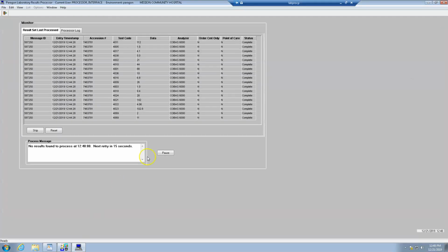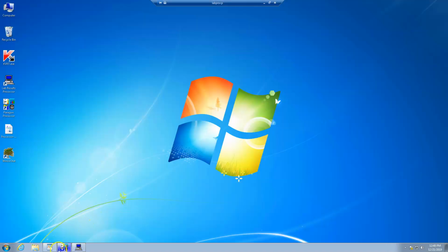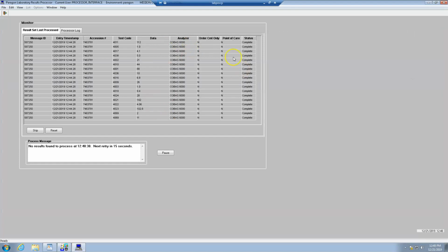If you see that you did that, and there's still no flurry of results coming in very fast, then your issue is with the server itself. Sometimes there are two services running, which is stopping the results from posting. So the best thing to do is to just restart the server and to log in as LabProc, open up both of these applications, and you should see the results flooding in.